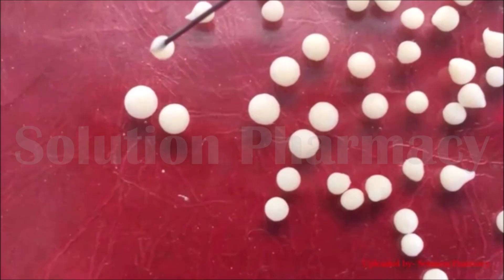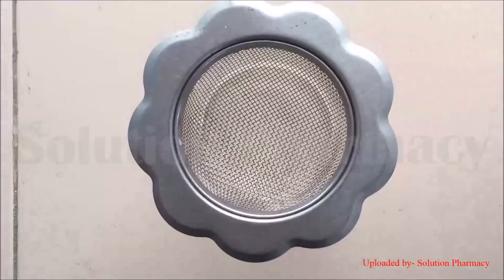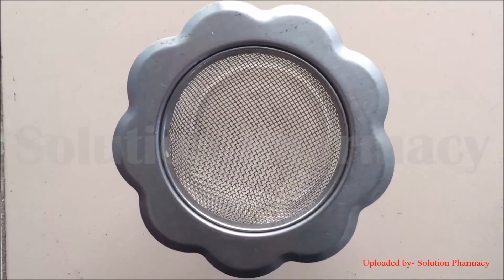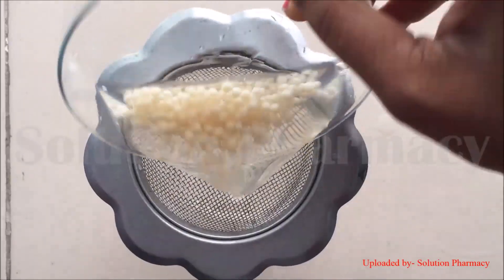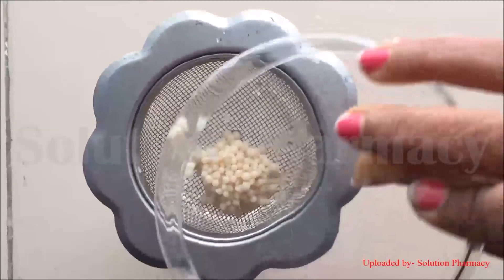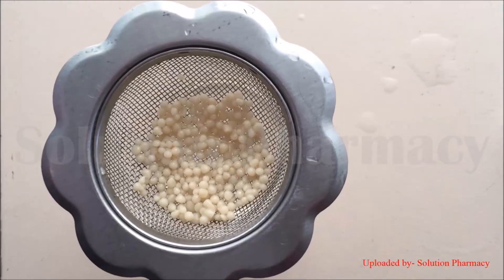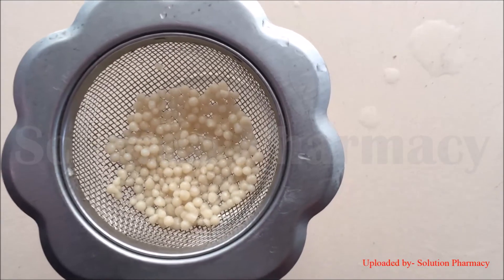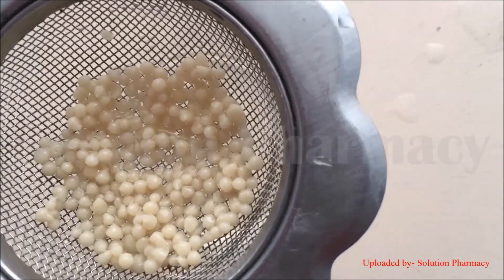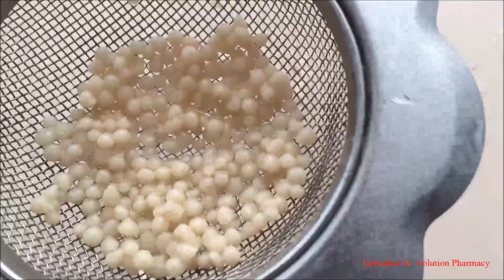Leave the beads in the calcium chloride solution for at least 20 minutes — preferably about one hour — to allow gelation of the beads to occur. After this, collect the beads: take a sieve, pour the beads from the calcium chloride solution over the sieve, and spread them with a spatula.